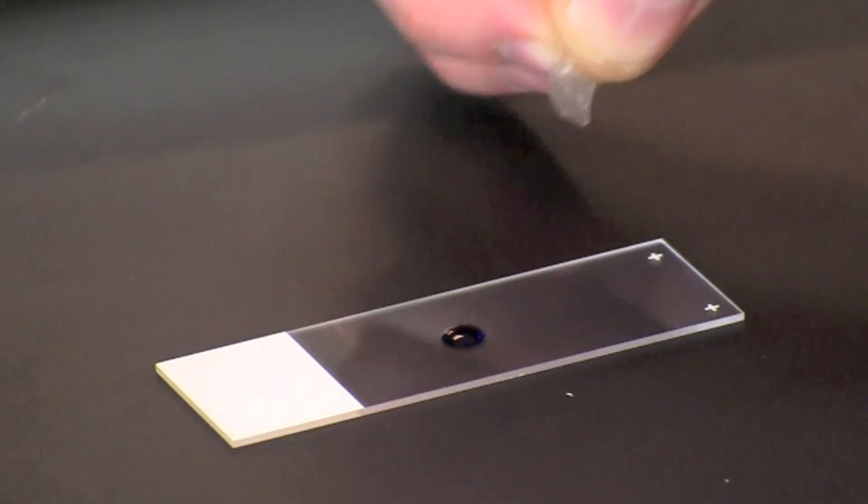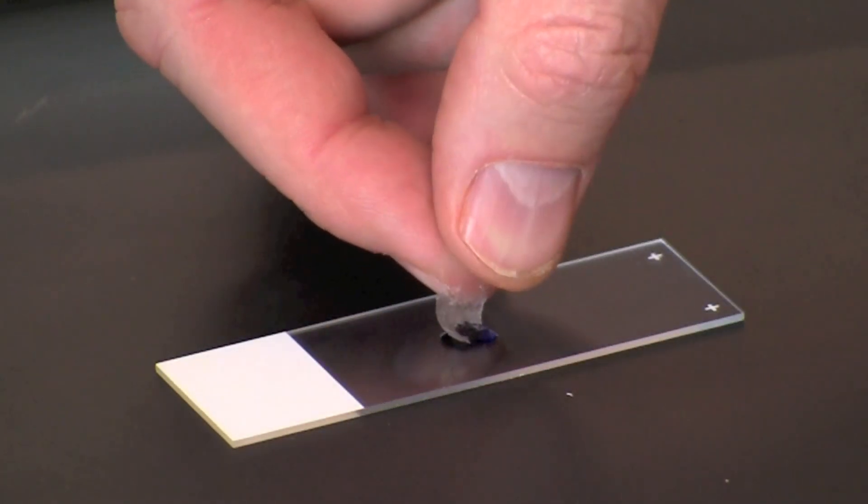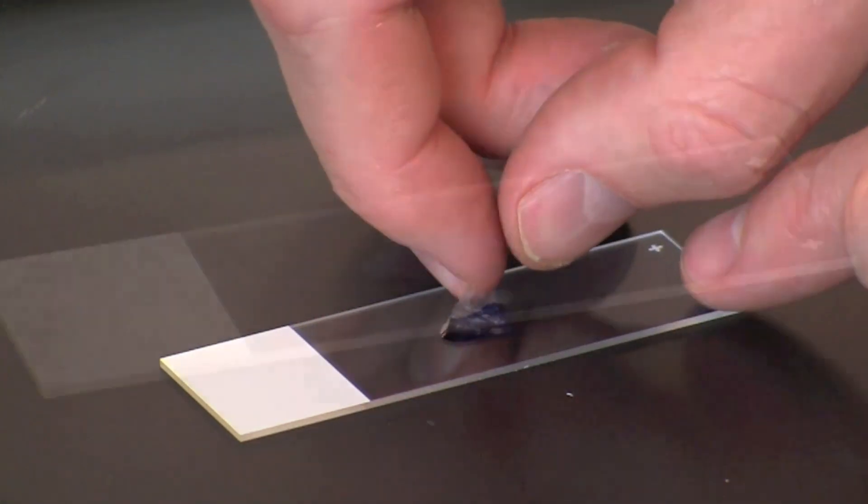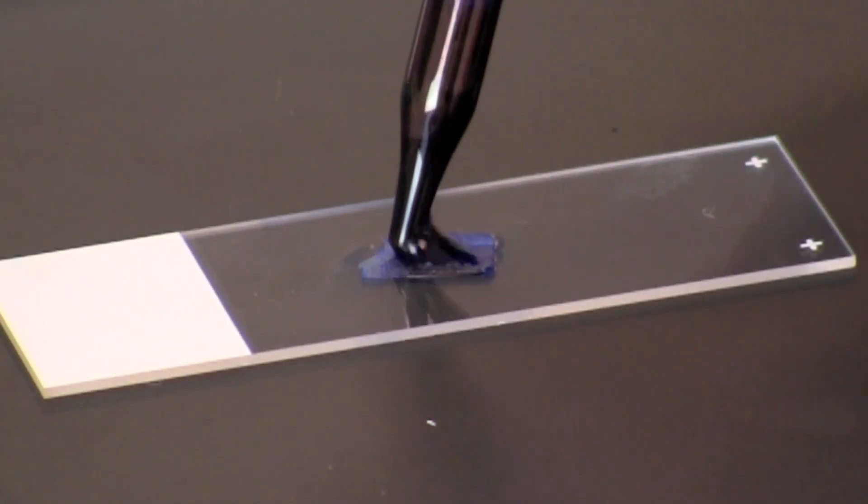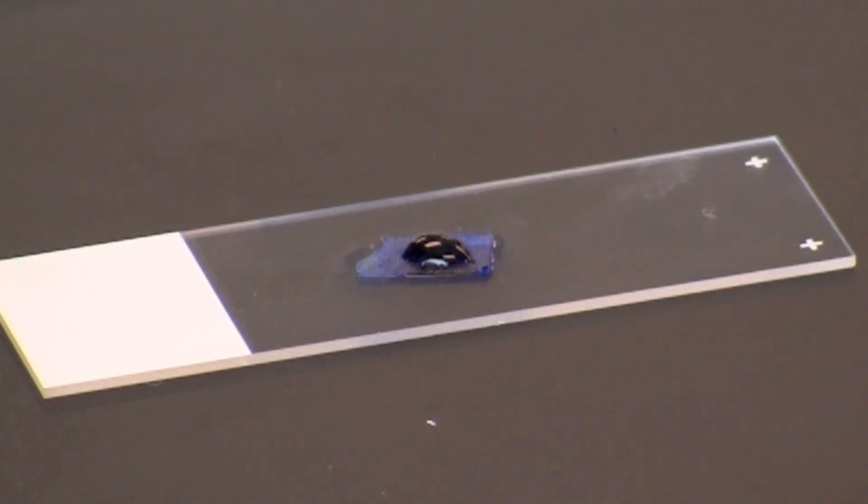Place the piece onto the drop of stain on the slide. Add another drop of fast-blast DNA stain on top of the piece of onion.